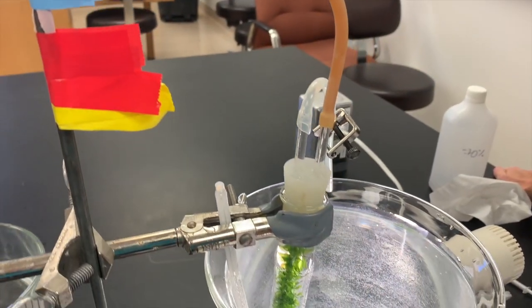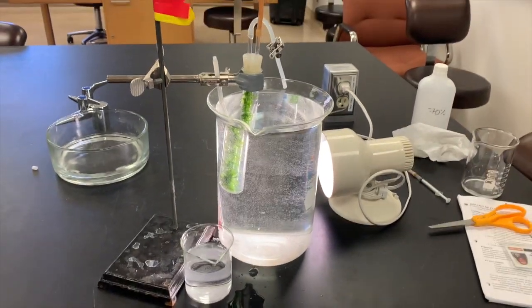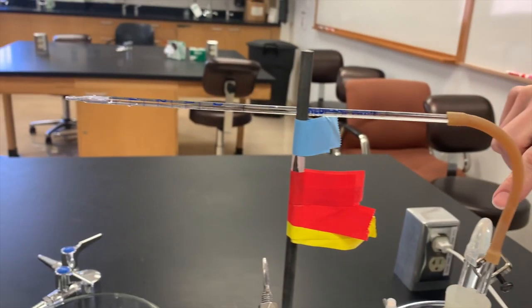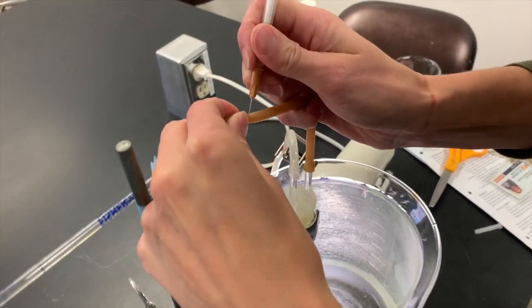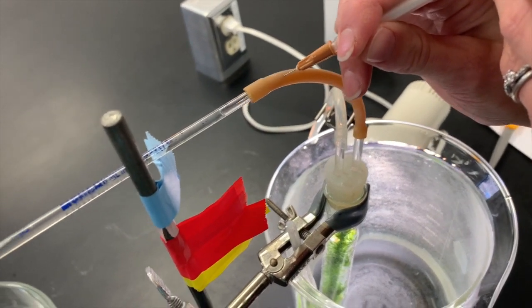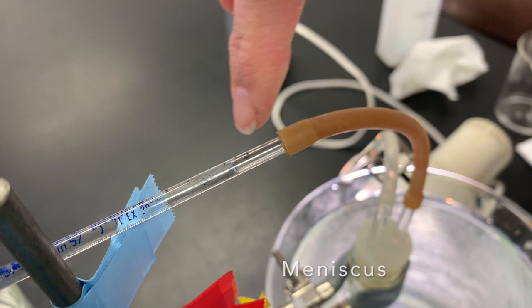You can see in our setup that the test tube is closed with a 2-hole stopper assembly, and we have placed the test tube in our beaker so that the water covers the solution in the test tube. Now you see that we have rubber tubing coming out of the top of the stopper on our test tube that is attached to a pipette that's filled with water, and we are introducing a small air bubble into the pipette where it is attached to the rubber tubing. And we're going to do this by inserting a very fine needle of an empty syringe into the tubing, and we're injecting air until there's a visible meniscus in the graduated portion of the pipette.